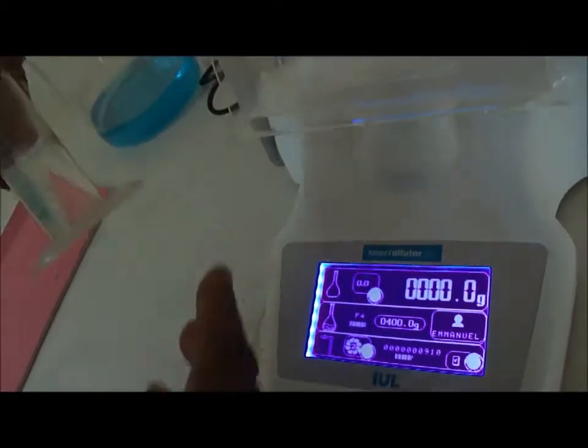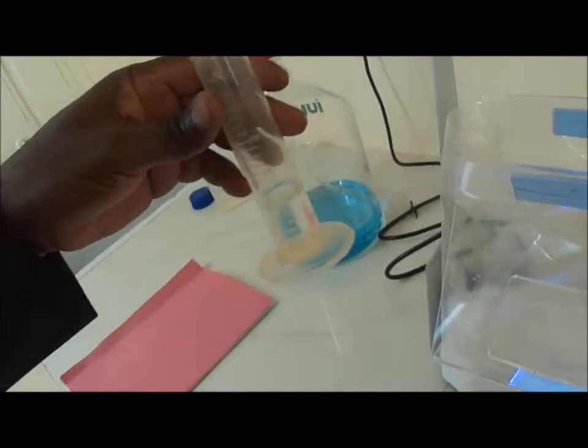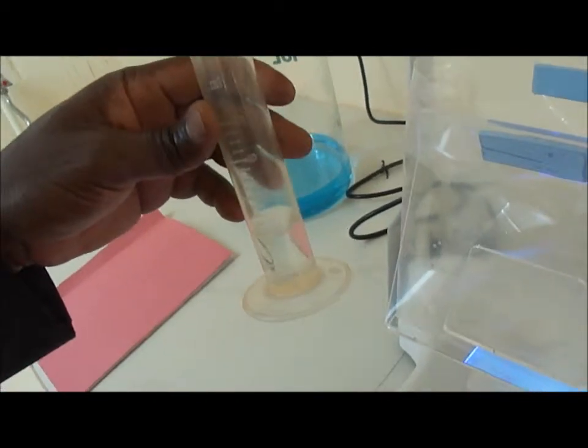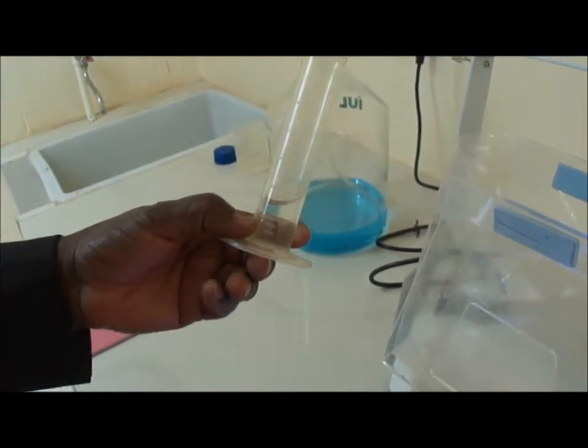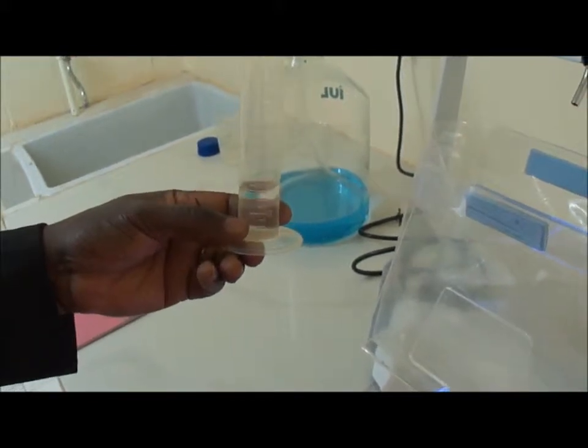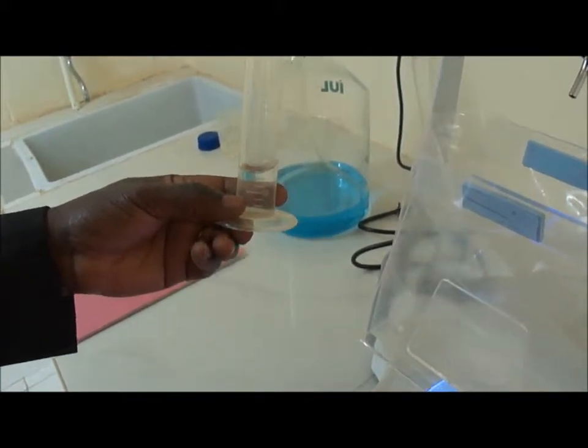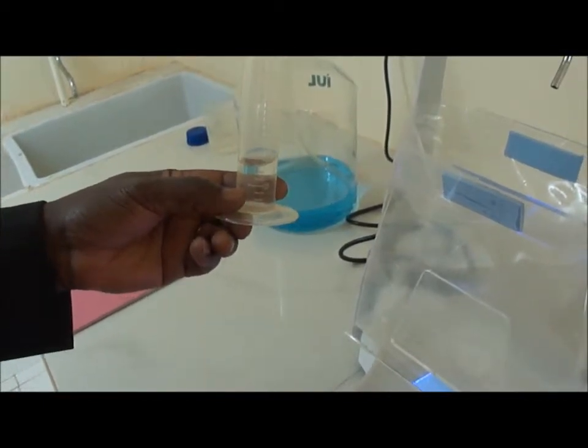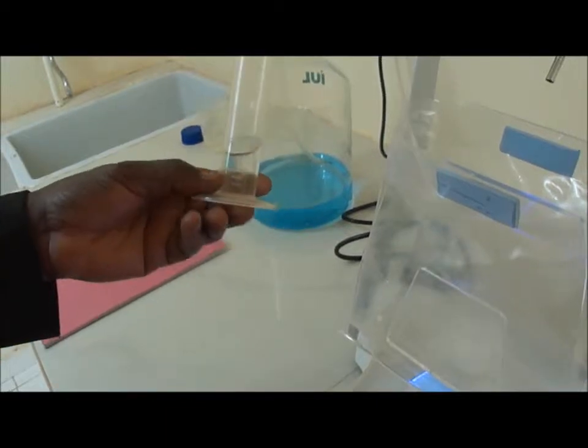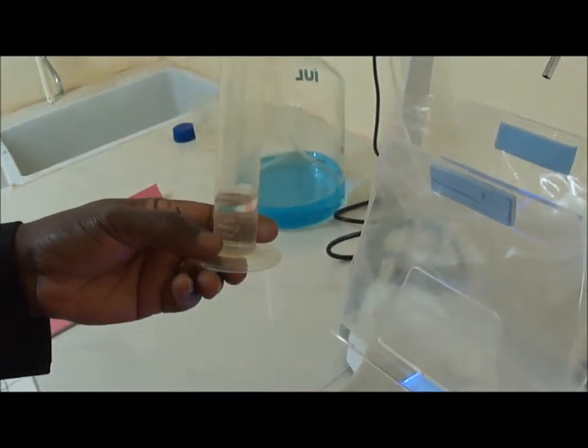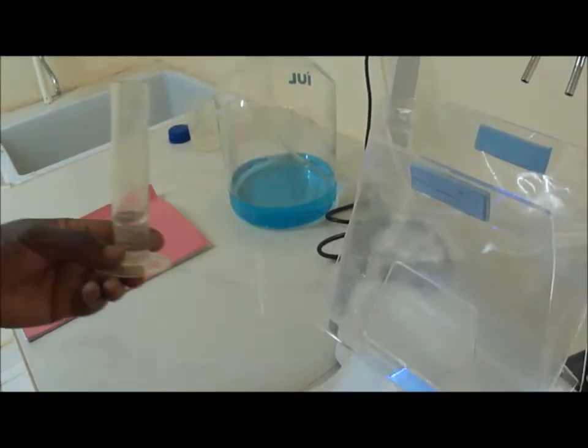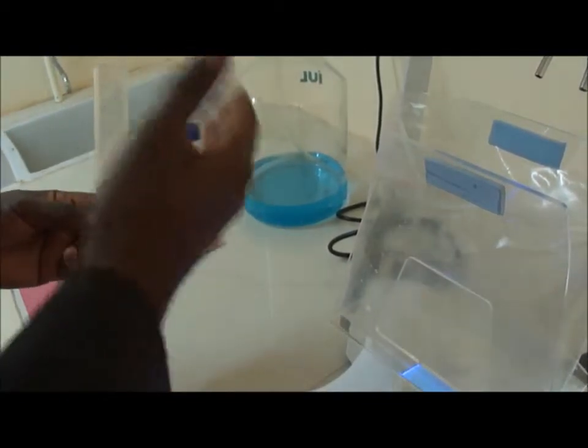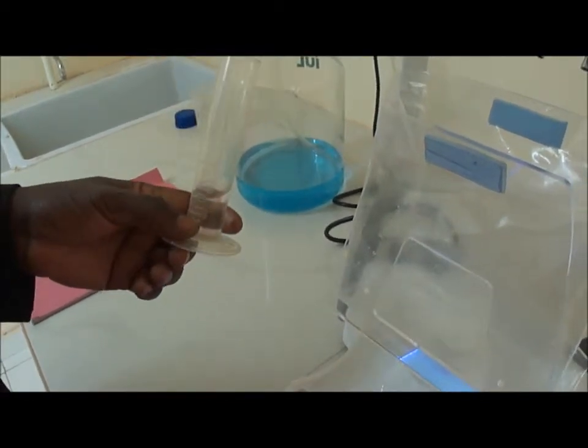Now, I have just taken here, this is a water sample that I consider like my example coming from the field. And by the way, if you are using, for example, a soil in which you want to study to make dilution, one method consists of changing the soil into a paste by using a dilution factor of 5. And then you can introduce the paste inside your bag and mix with the diluent or the dispensing substance.